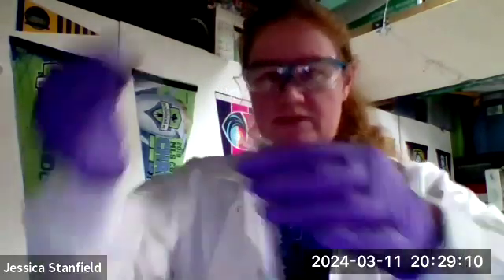Okay, all right, let's see here. I'm going to use the copper(II) chloride again. I put some copper(II) chloride in my test tube. Now I have some silver nitrate. My silver nitrate will form an insoluble salt with the chloride. So silver, when it reacts with a halogen ion, so iodide, chloride, etc., forms an insoluble salt. Okay, so here's my silver nitrate, and we should see a solid precipitating out.